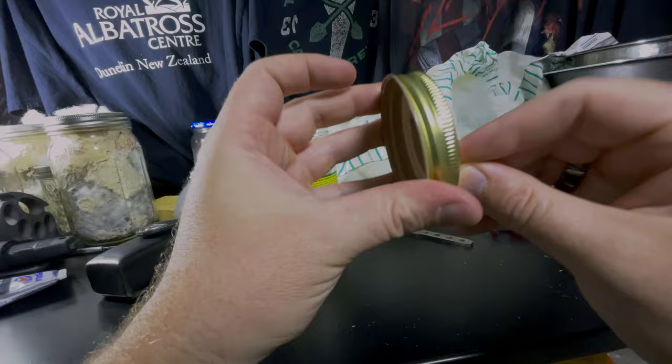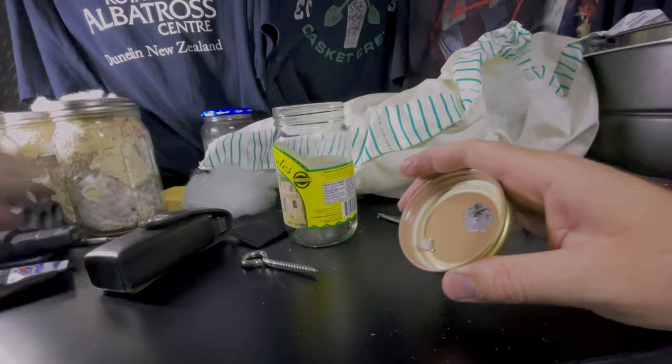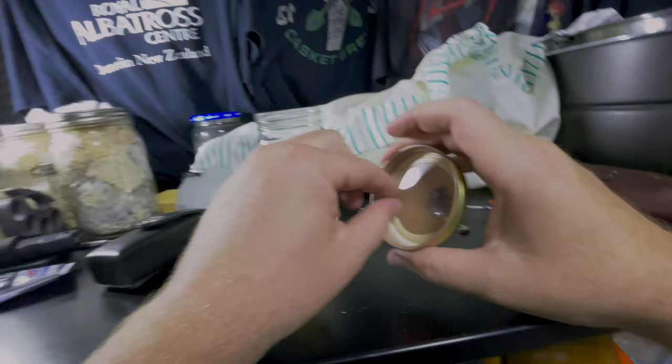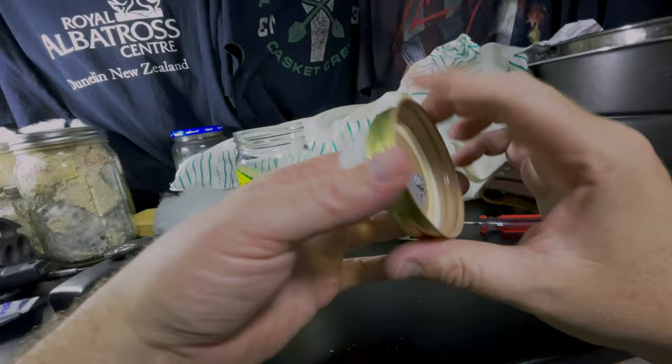Those sharp bits on the inside, be careful of those. You can flatten them out if you want to, even just using something like a rock. And just push. But we don't really need to, because it's on the inside. You're never going to touch there, and hopefully there's going to be stuffing. It'll help grab the stuffing and hold it in there too. But that's it. Take a look around your glue one more time. Make sure it looks set.